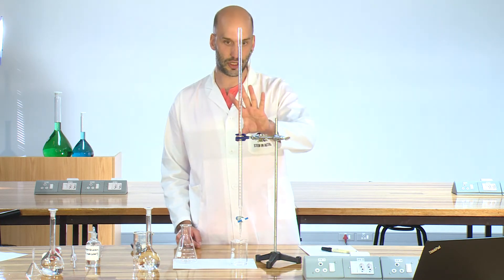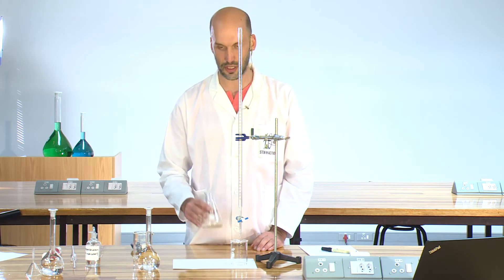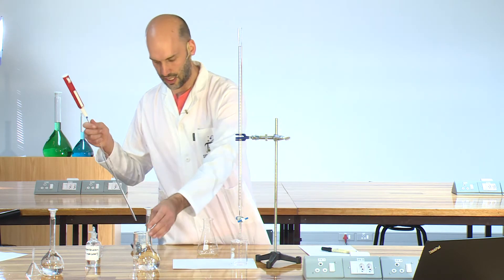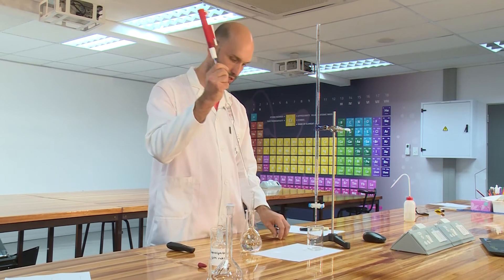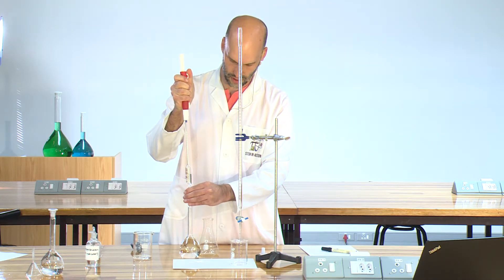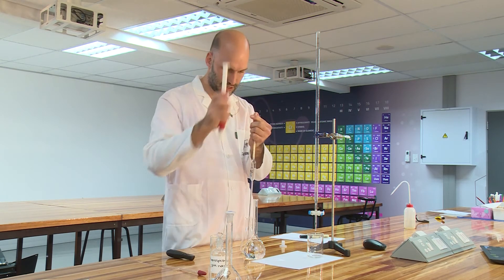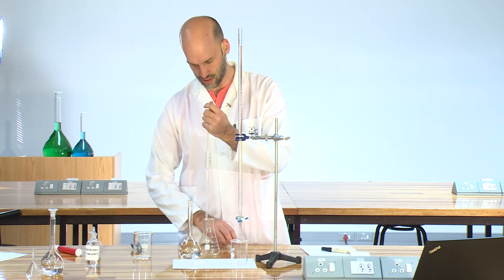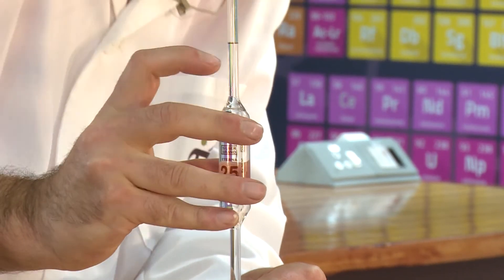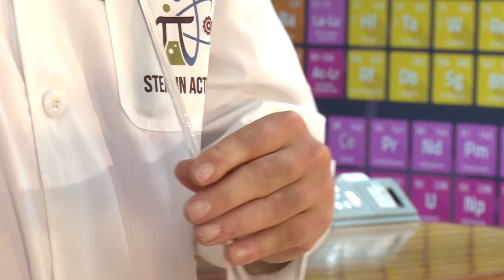Our standard solution is now prepared. The next step is to place 25 milliliters of our unknown oxalic acid into our conical flask. For this I have a pipette, graduated to 25 milliliters. I am going to draw it up using the pipette pump, drawing up my oxalic acid solution. The meniscus is on the line, and I am going to release it into the conical flask. As you can see, the meniscus is on the 25 milliliter mark, so we know we have exactly 25 milliliters.